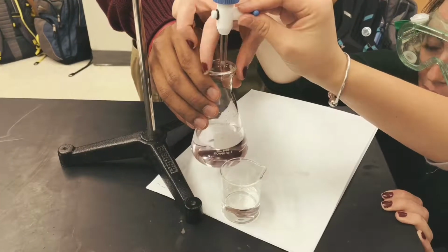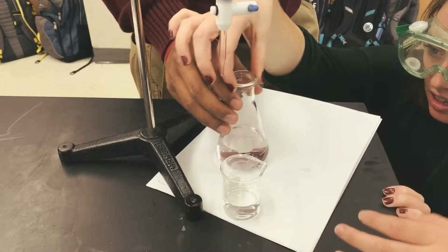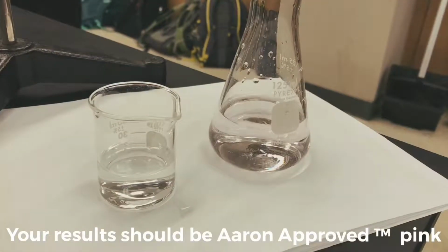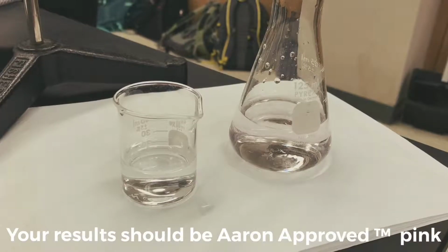Wait, it might be pink. Wait, put it down. It's pink. It's perfect. So we can try and look at it? Is this pink? Yeah, that's pink.